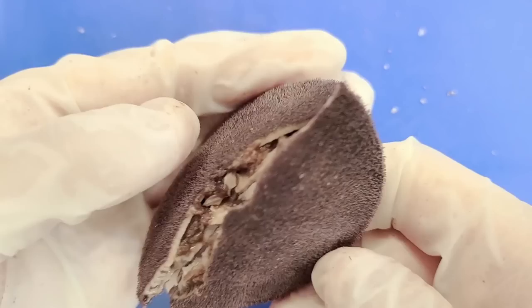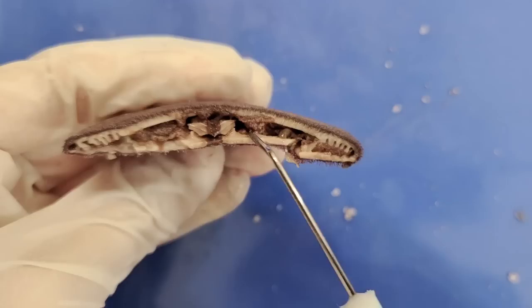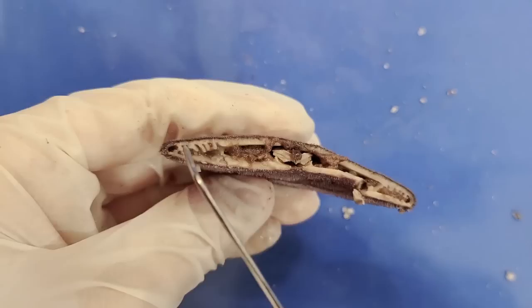I've also snapped a different sand dollar in half to get a transverse section. If you look at it, we can see there's an internal space for the body cavity and all the organs, and then there are these pillars of test at the edges, which makes the sand dollar really hard and rigid.